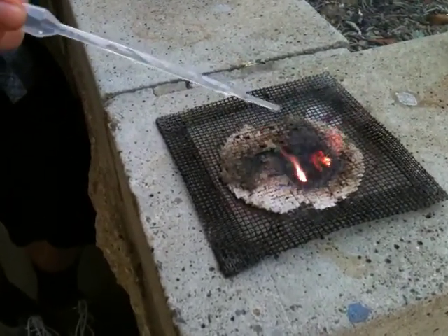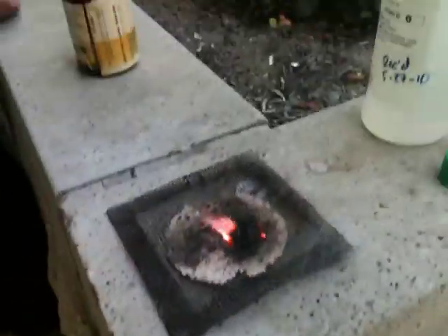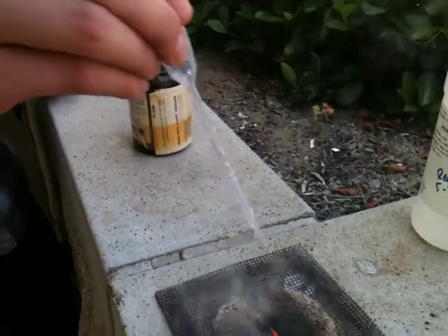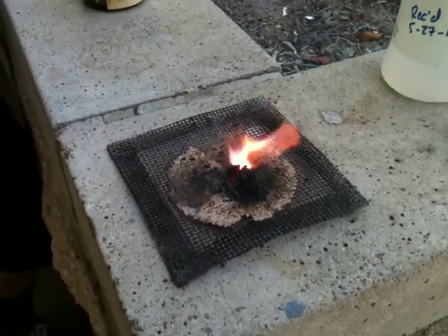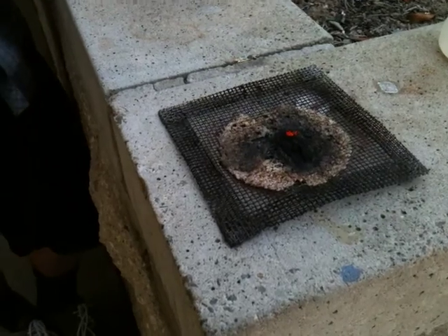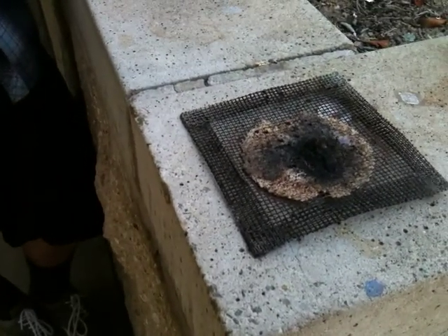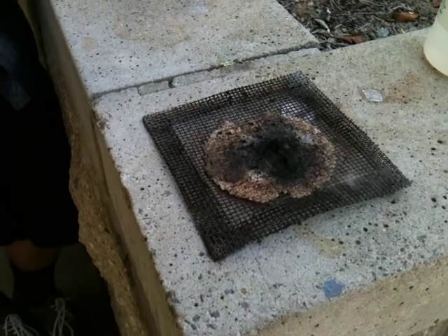More of it. Yeah, that doesn't look totally reacted. Ow! Yeah, I'm fine. Did you get a random ember on you? Yeah, I did. We need to be able to drop more glycerin on it at once. Yeah, we do. We can get a little bit more and it can make one more little tiny flame.